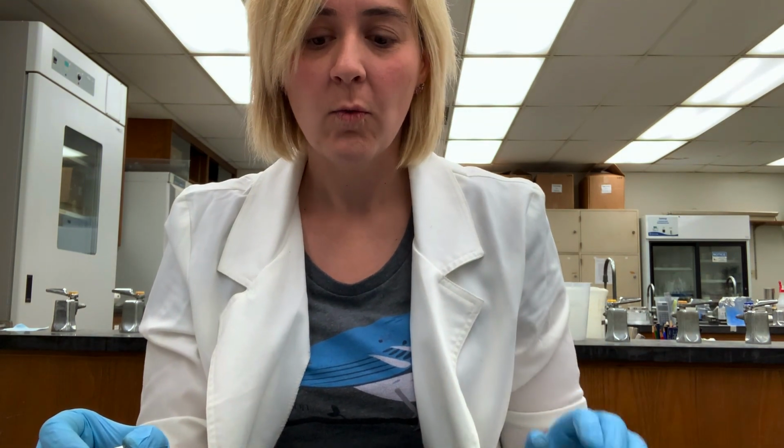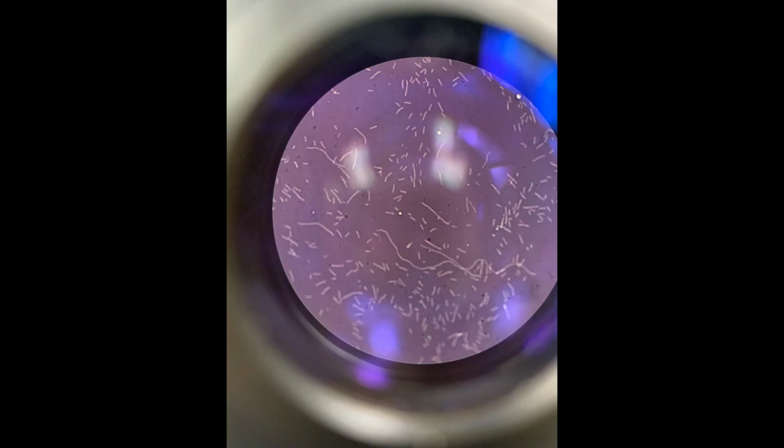So what we'll do now is wait for that to air dry. So that'll take some time. Once it air dries, we'll visualize it under the microscope, and I'll show you what it looks like. So just like before with the direct methylene blue stain of Klebsiella, the Klebsiella wasn't concentrated enough. So I went ahead and redid the negative stain using E. coli, because the E. coli was much more concentrated. And so what we're seeing in this image now is the negative stain.